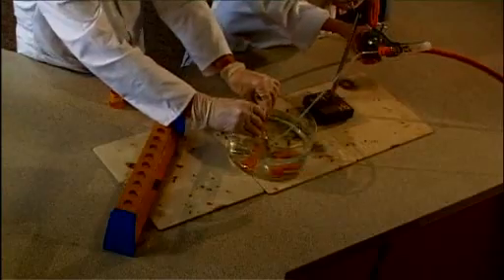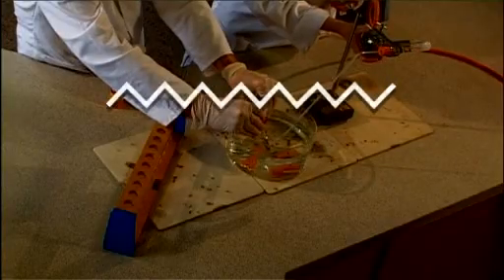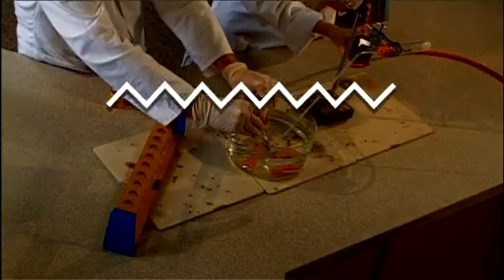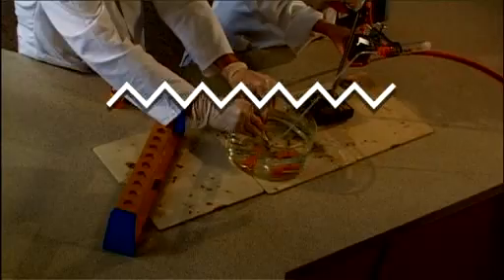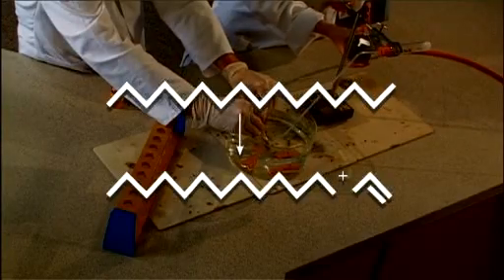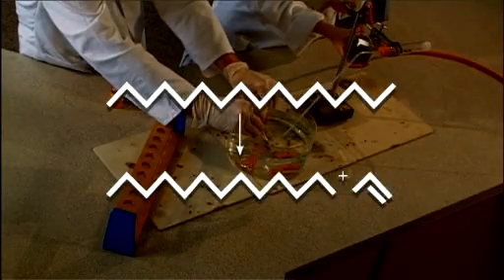This experiment models the industrial catalytic cracking of long chain alkanes and shows that some of the products have shorter chains than the starting material and that some are alkenes, they have carbon-carbon double bonds.